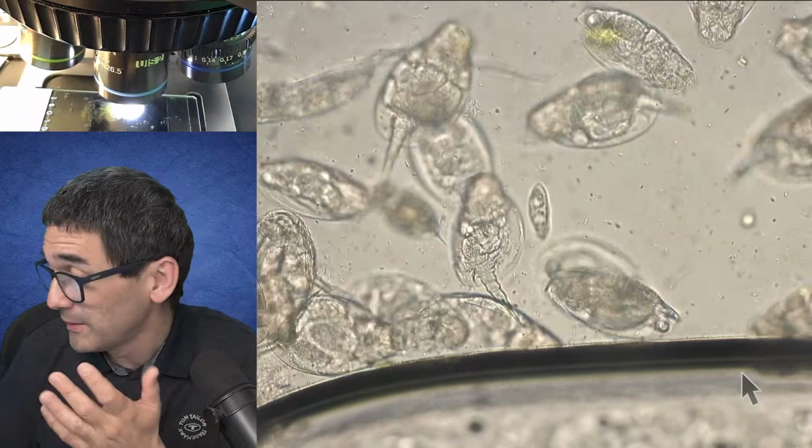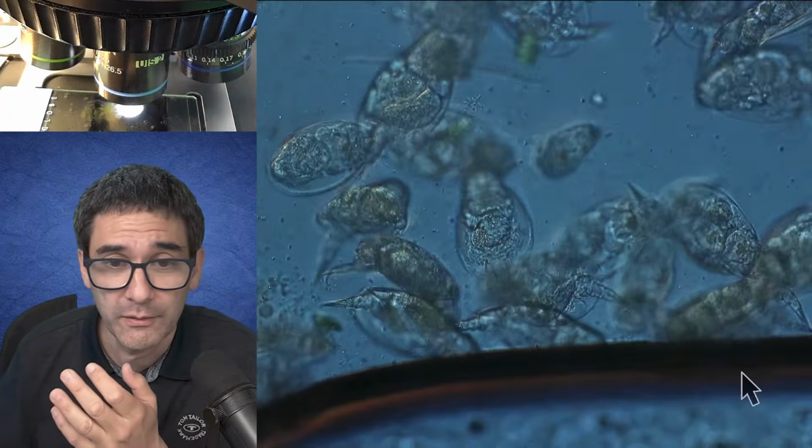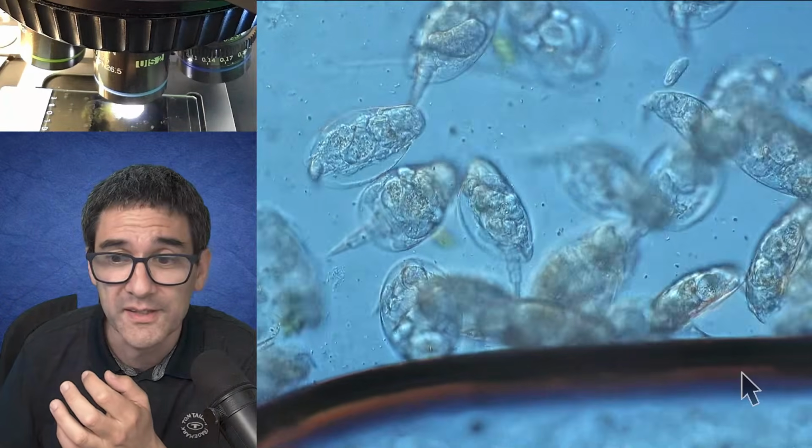Fascinating. I've been doing this for so many years, and I'm still always fascinated by this.